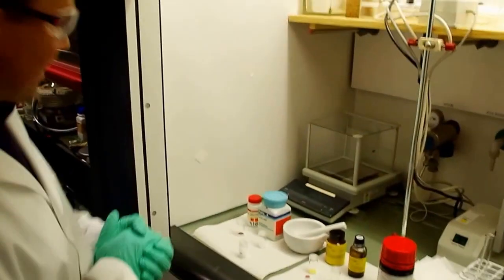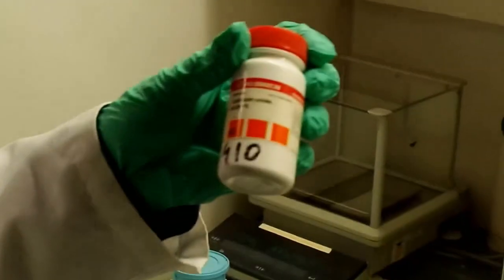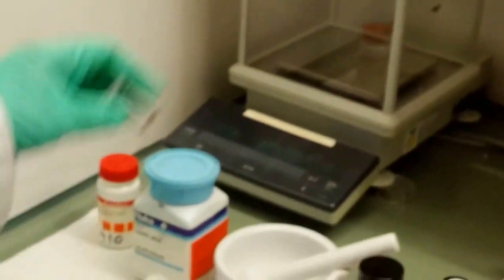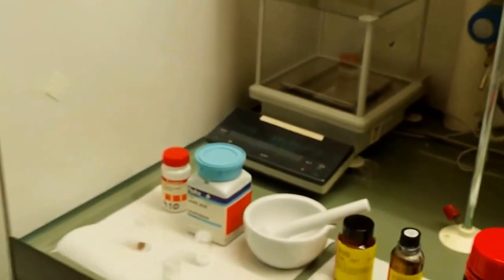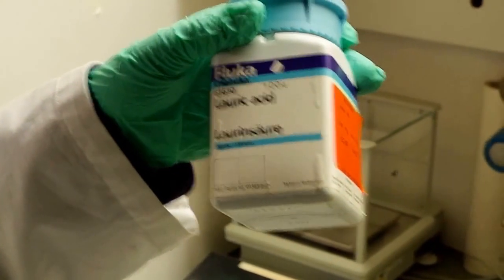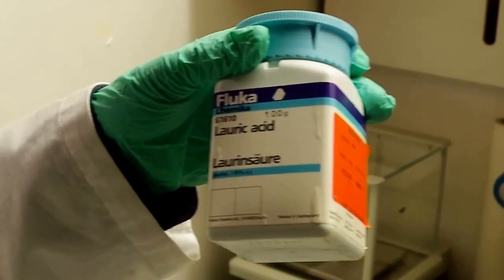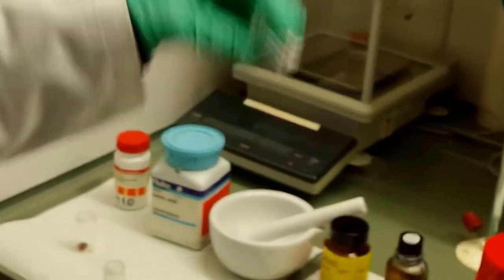So what do we need to make cadmium sulfide nanocrystals? We need a cadmium source, which is cadmium oxide. But be careful guys, because cadmium oxide is very toxic. It looks like this, a brownish red powder. Cadmium oxide must be dissolved in lauric acid, which is a fatty acid which contains 12 carbons. You can also take stearic acid with more carbons, like 18, or hexanoic acid. Does not matter. It's a white powder, so it's not harmful.